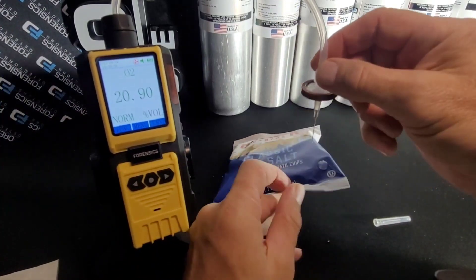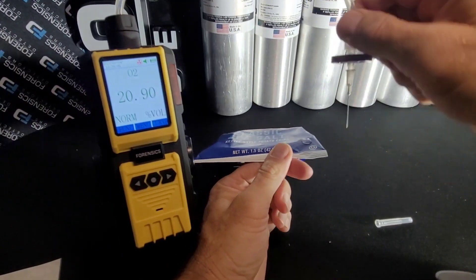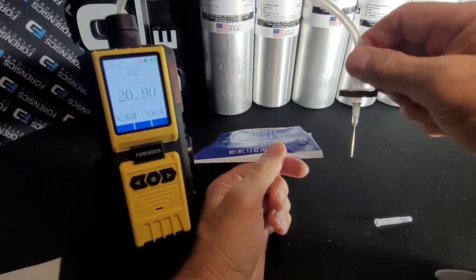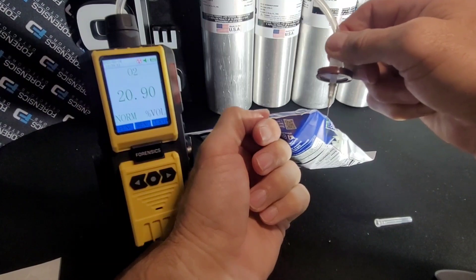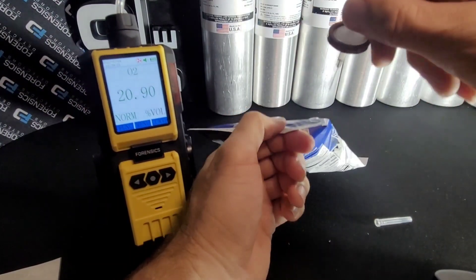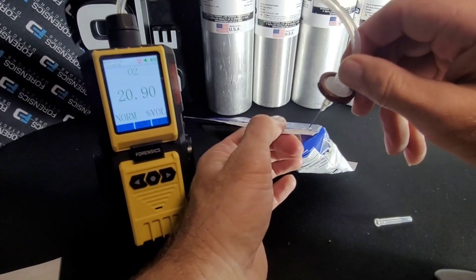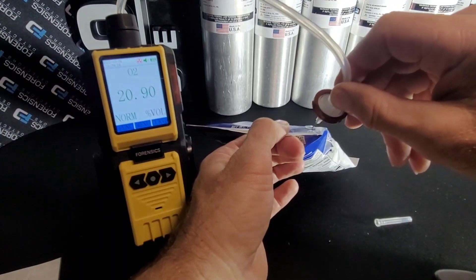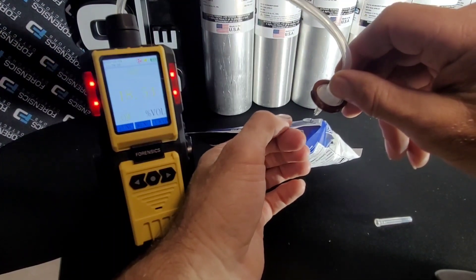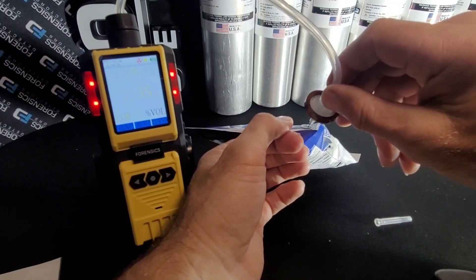Next procedure: we're going to come in on an angle — an angle of incidence. We're not going to go straight down to poke ourselves. Going straight down is dangerous and you could go through the package. So you want to come in at about 45 degrees. It's going to strain through the rubber and open it up again once the needle orifice enters the packaging.